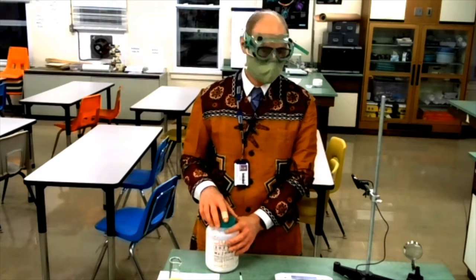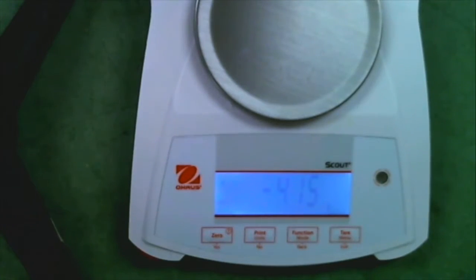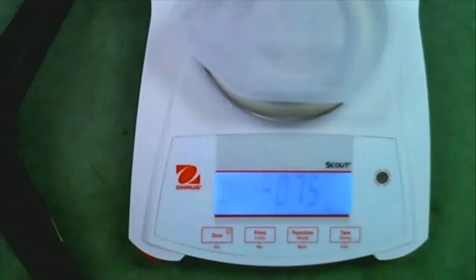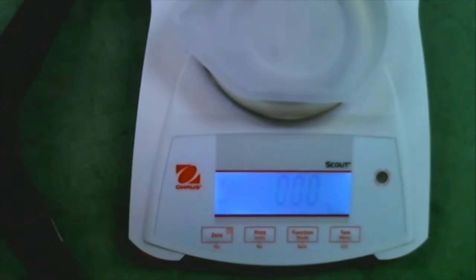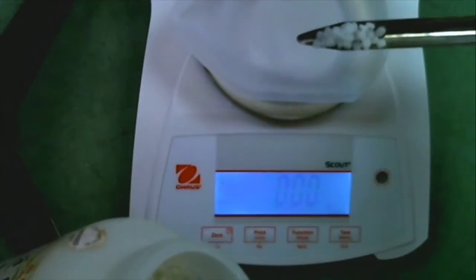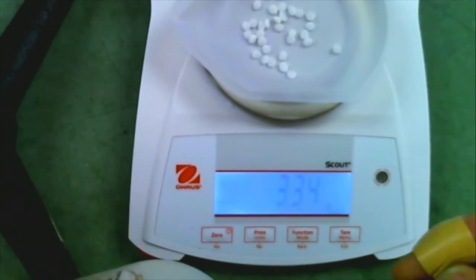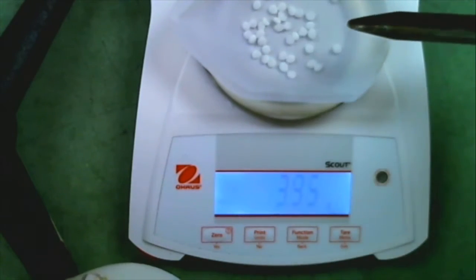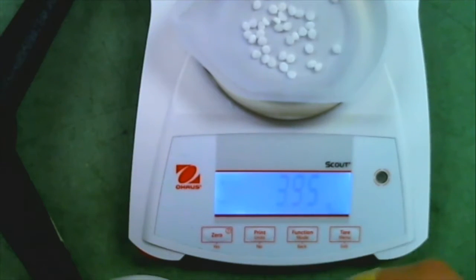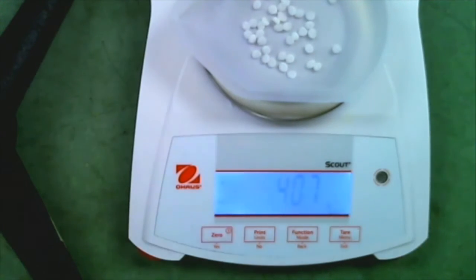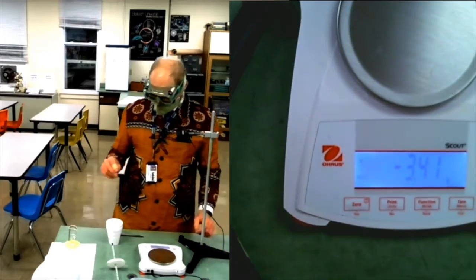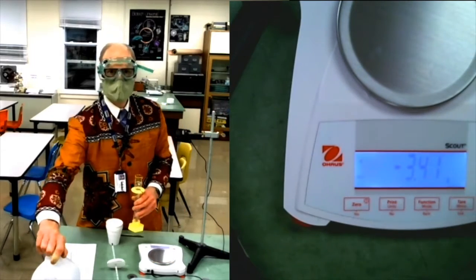So it causes very severe corneal burns. I want to use only four grams of this. Three point nine five is pretty darn close to four. That was closer, but now I put us over. Four point zero seven grams. The water.